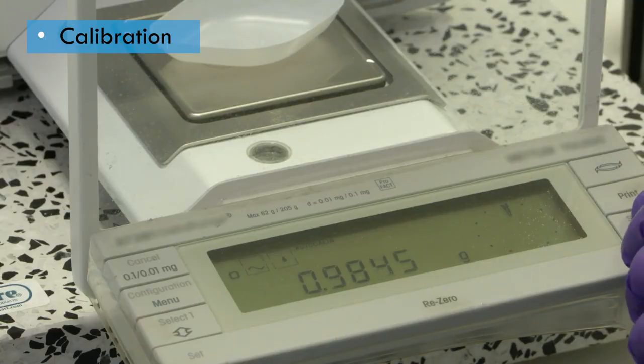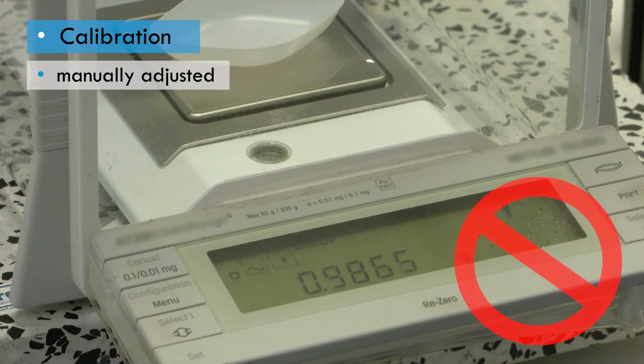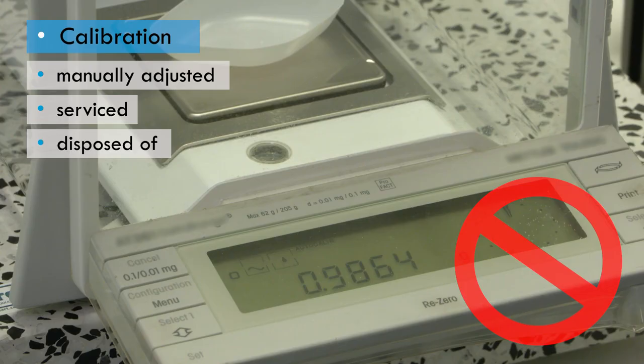If the pipette is out of calibration, that is, the set volume and weight do not correlate, the pipette may be manually adjusted, or may need to be serviced by an engineer or disposed of. Pipettes that are inaccurate should not be used.